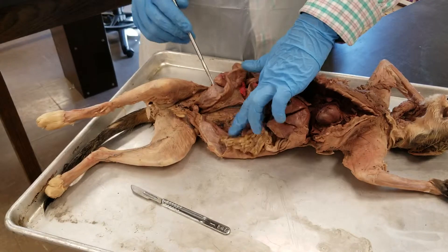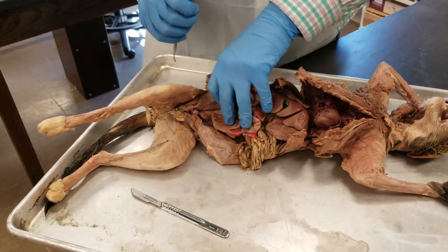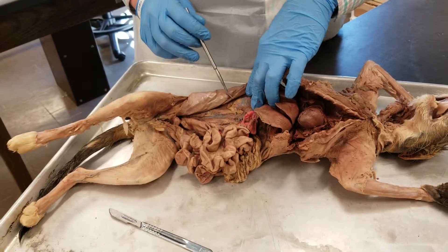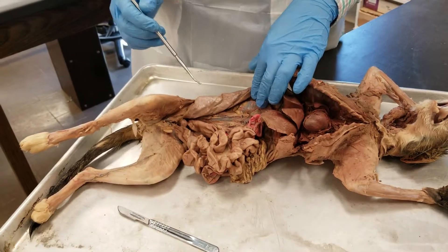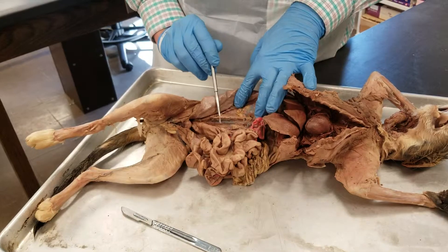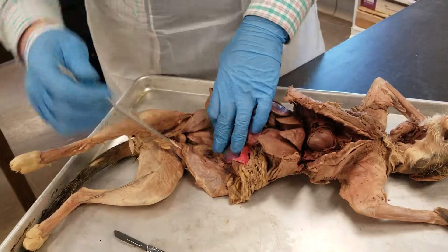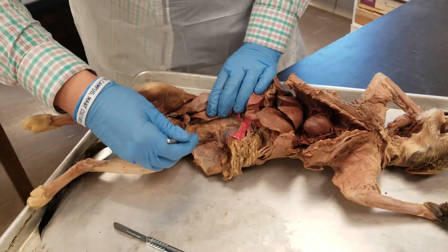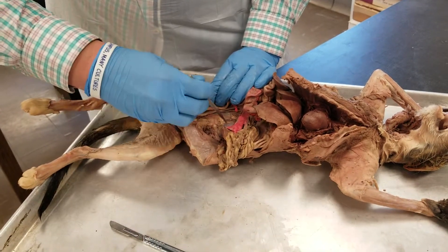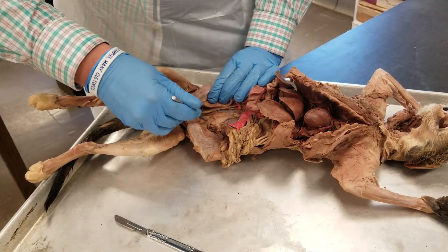Then we have the kidneys. Over here is the left kidney, and in here is the right kidney. The ureters for both — this is the ureter for the right kidney, and the ureter for the left kidney.